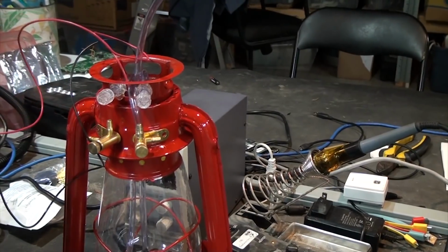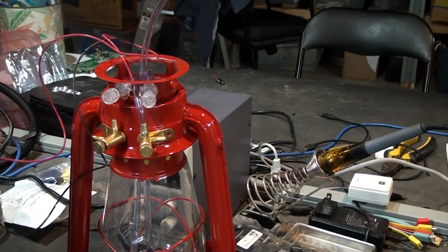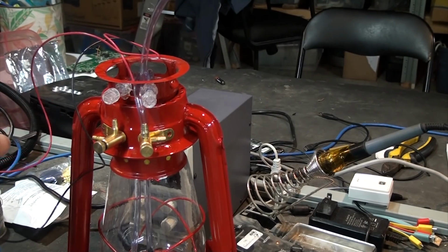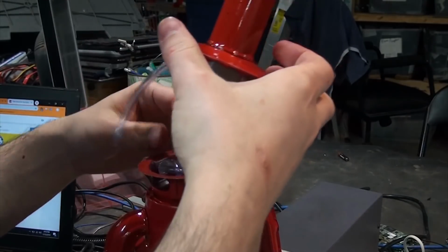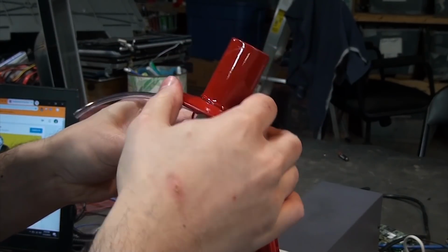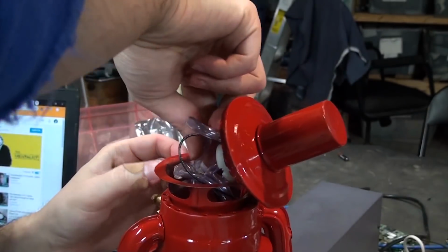Speaking of which, I chose one of the larger vent holes to have everything mount through. I used some double-sided luer lock adapters I had laying around to act as connections for attaching the pump lines later, and for the gases, I added two brass valves. The final connections were between the input line and the air pump, and then the air pump to the brass valve. This step was a bit finicky as I had to pull the wires through and all the tubing in place all at the same time so that everything fit together nicely.